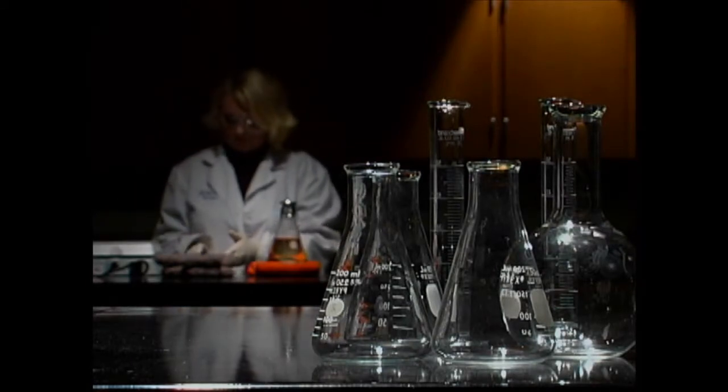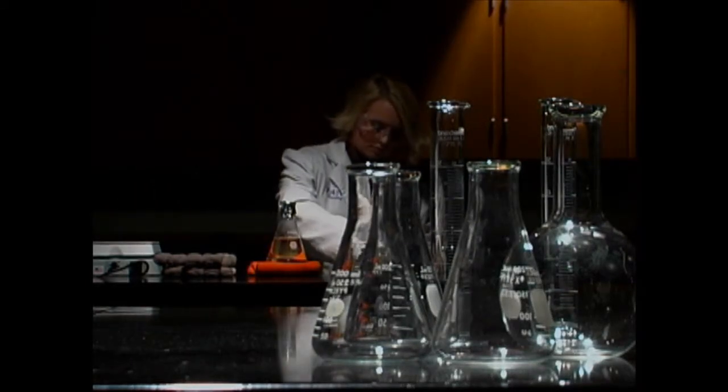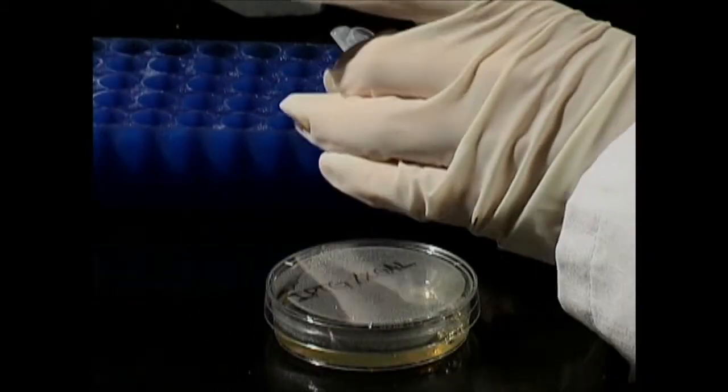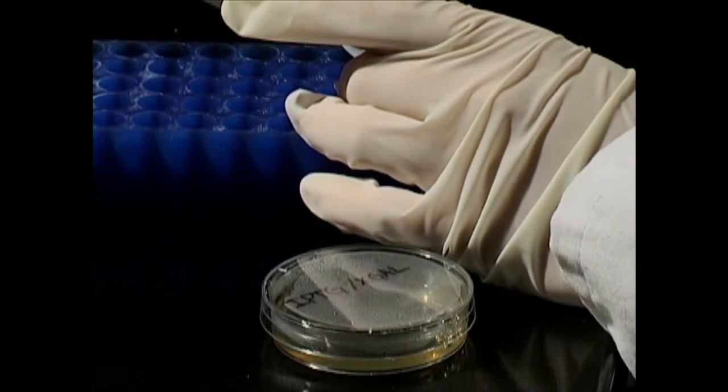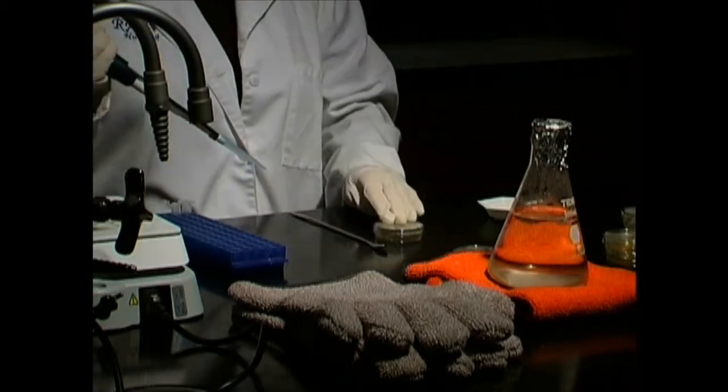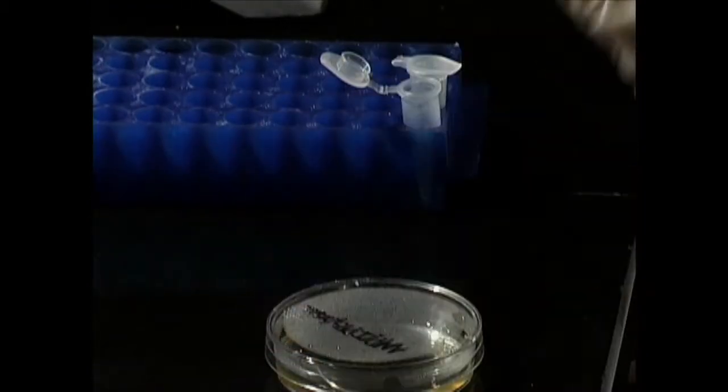When the cells are ready, they need to be inoculated onto three separate agar plates. They all contain a chemical inducer, IPTG, and the colorless chemical substrate, X-gal, which will be affected by the presence of the PUC8 plasmid. One of the control plates and the DNA plate also contain ampicillin, an antibacterial agent.